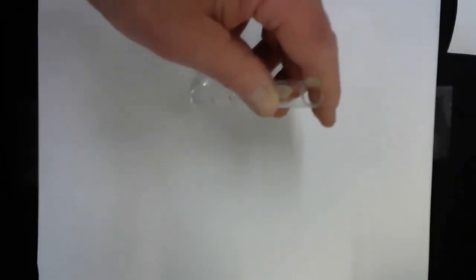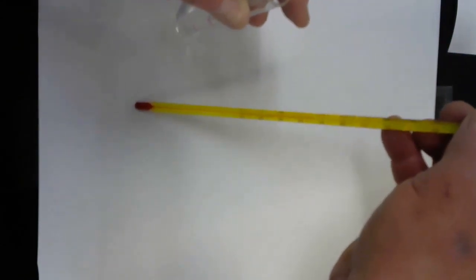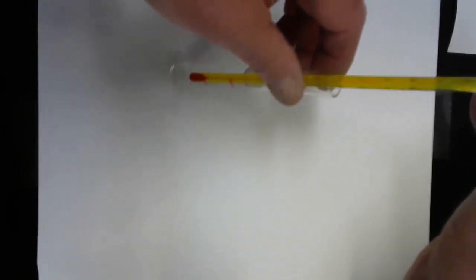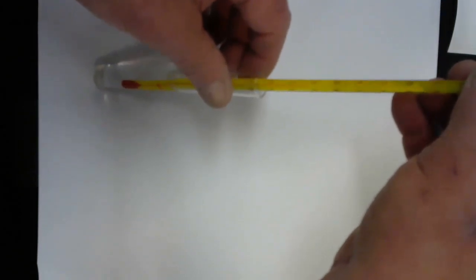And the test tube has not formed any bubbles. There's no precipitate. And I don't feel any heat. But just to be sure, I'm going to take a thermometer. The thermometer is currently reading 17 degrees Celsius. And I'm going to just stick it in the solution for a minute or two, and I'm looking to see whether there's a temperature change. I don't really see one.